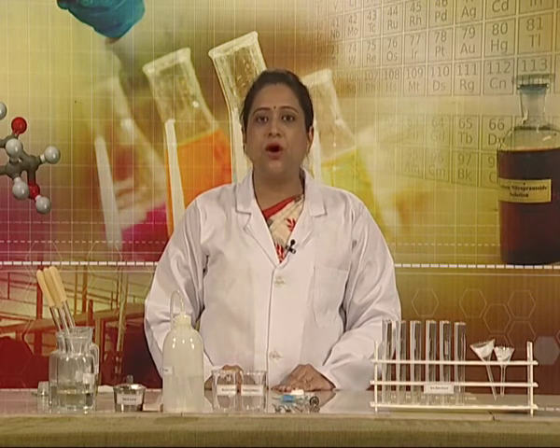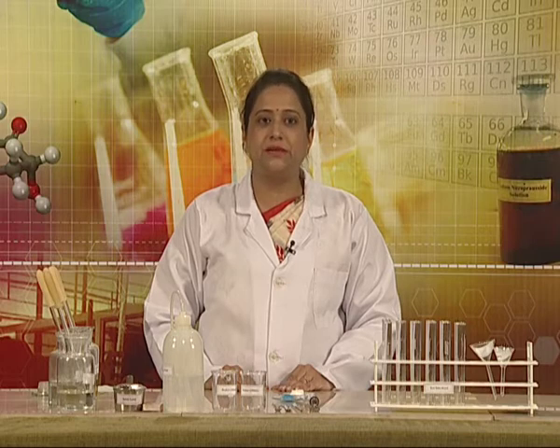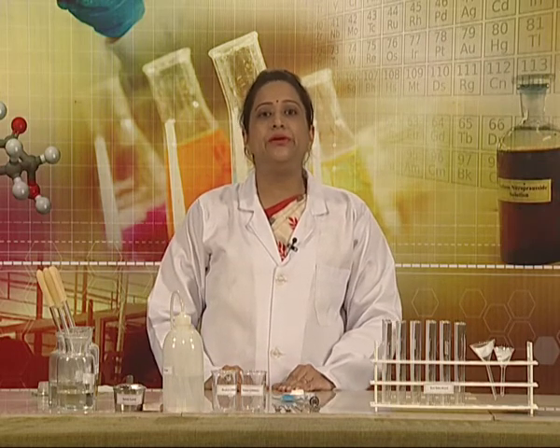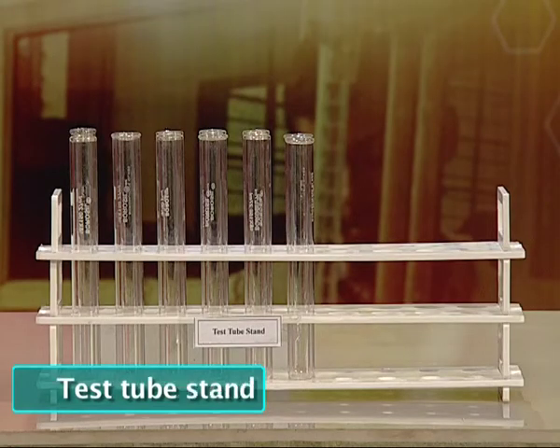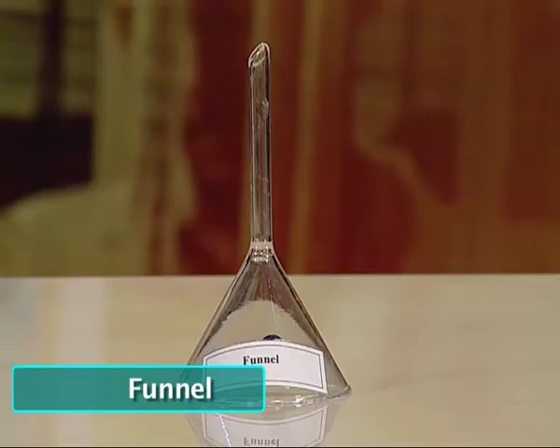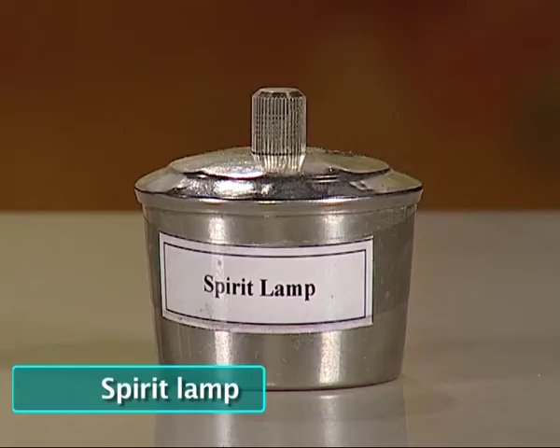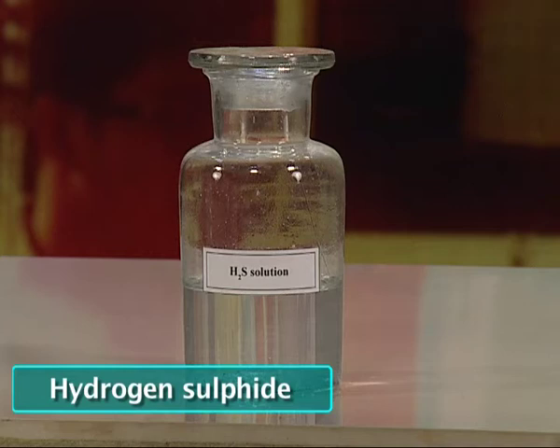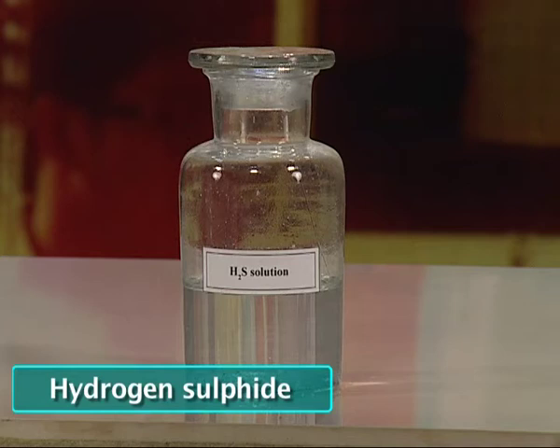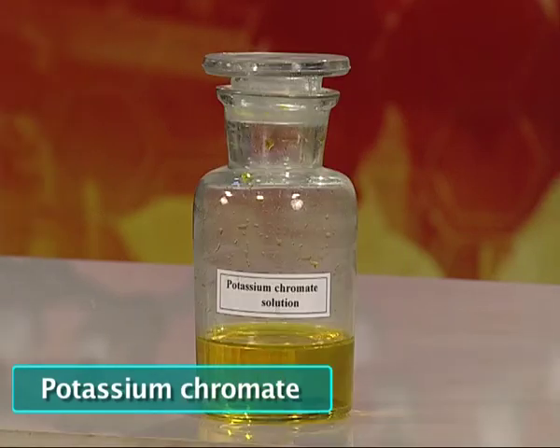Precipitates of sulfides of lead and copper are taken for performing the confirmatory test. For today's experiment, we shall require the following apparatus: a few test tubes, a test tube stand, funnel, test tube holder, some spatula, beakers, distilled water, spirit lamp, dilute hydrochloric acid, hydrogen sulfide solution (made by passing hydrogen sulfide gas in distilled water), dilute nitric acid solution, potassium iodide, and potassium chromate solution.